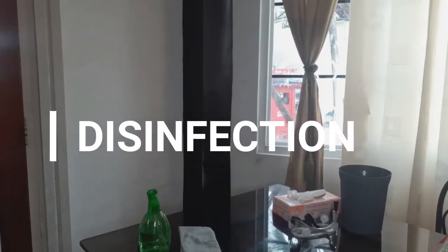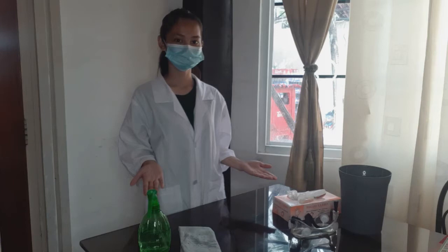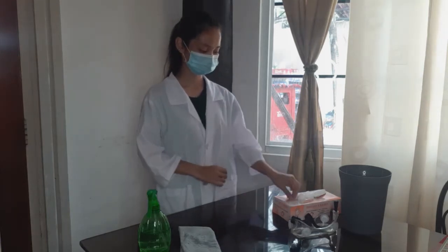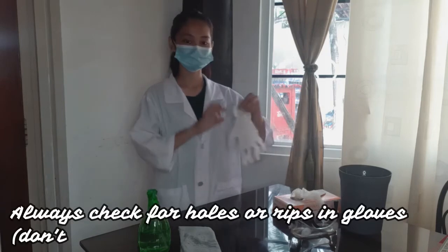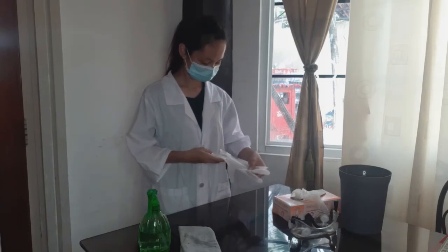The second is disinfection. Before and after using or working on your working area, disinfection must be done. After hand washing, you can now wear your non-sterile gloves, but always check for holes and rips.